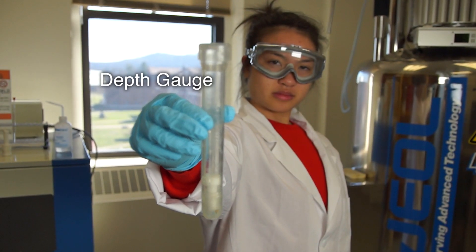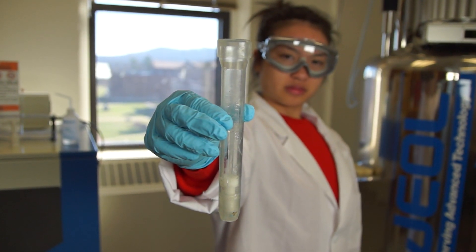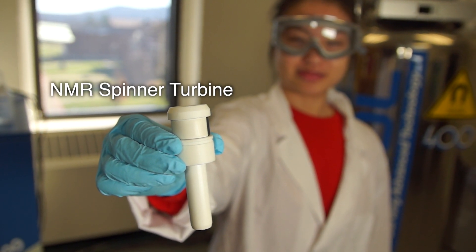Here's a closer look at the NMR depth gauge. And here's the NMR spinner turbine.